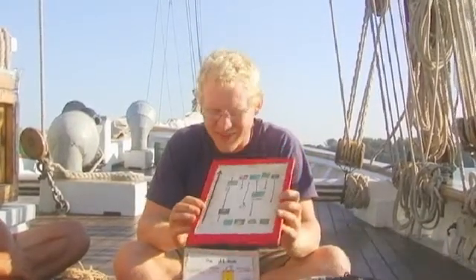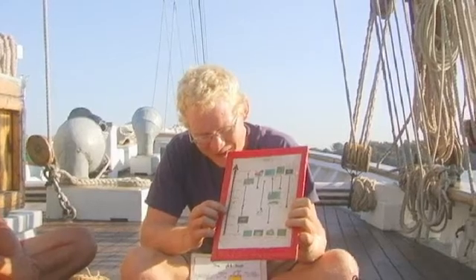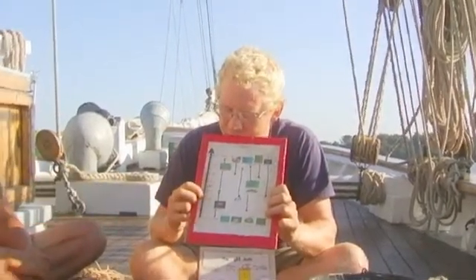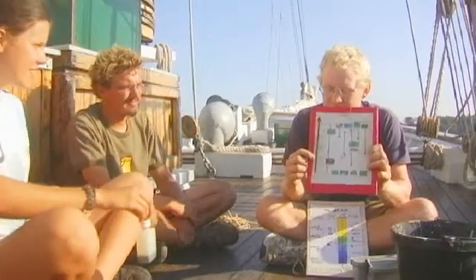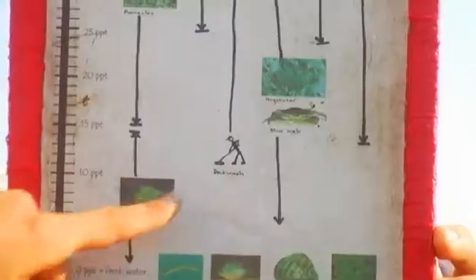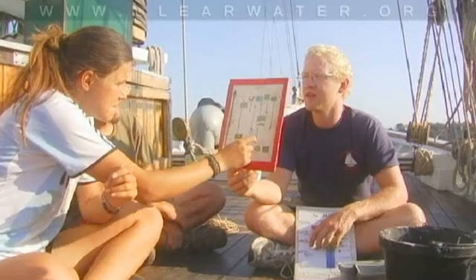Let's talk a bit more about salinity. We got twelve parts per thousand salt. On this chart, we can find how much salt is in the water and look over to see what kinds of fish can live at that salinity. What kinds of fish live at twelve parts per thousand? White perch, blue crab, and hog choker — just like the hog chokers and white perch we caught earlier today. There's a lot of cool stuff you can tell about water by doing some pretty simple experiments, and those water properties affect what kinds of fish can live there.